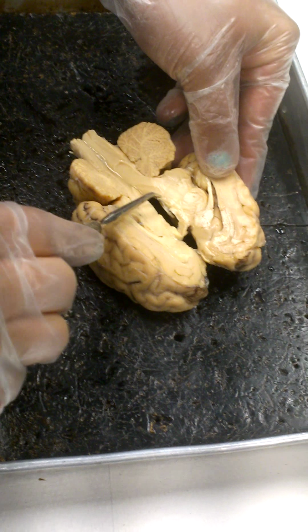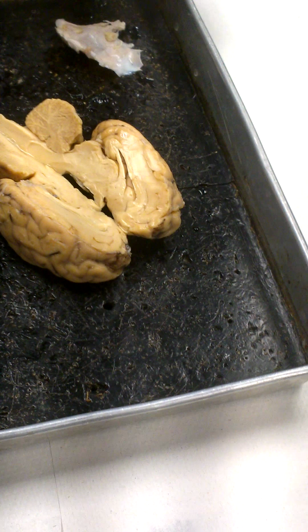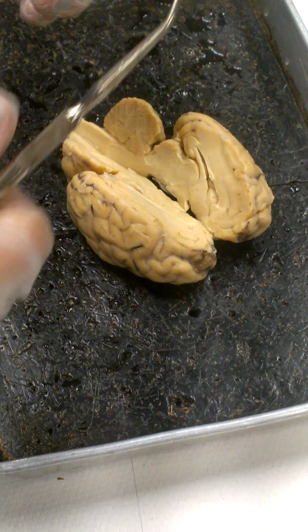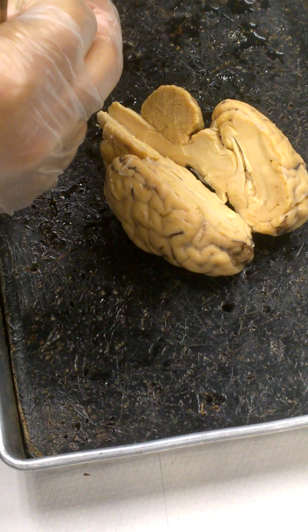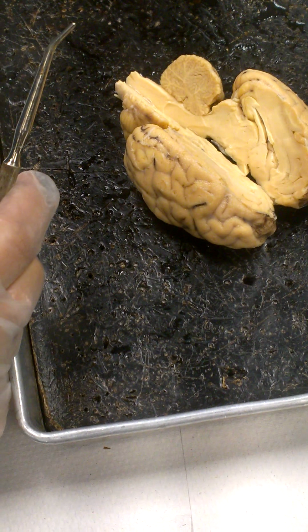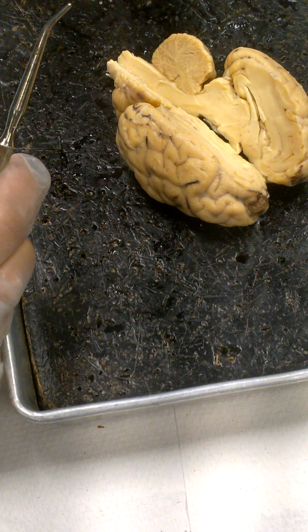All right, the pituitary gland is not on this sagittal section, so that particular little gland, I gave you that membrane, it's been removed, guys, so that we could make that sagittal section easily. If your pituitary gland is still in place, it'll be a large white structure, right about here, hanging off the undersurface. I do have a pituitary gland still in place on this one, and that's why I saved this one. With the membrane still intact around it on the inferior view, this large structure right here.